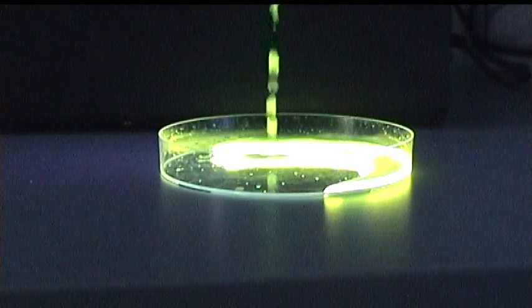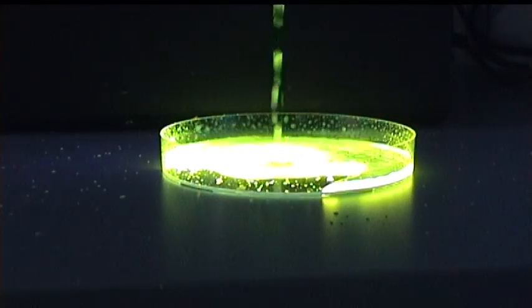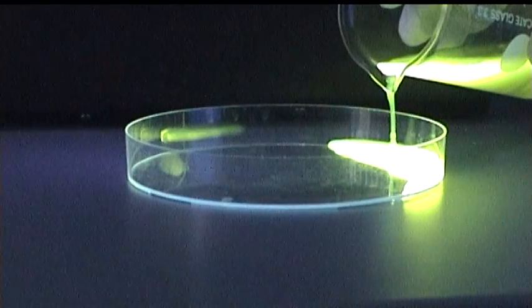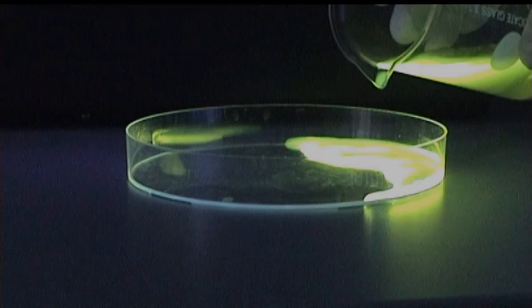Pouring liquid from heights is another activity which can generate aerosols. Pouring from great heights produces a large amount of aerosols and splashes. It is better to gently pour the liquid into the vessel, trying not to make any sudden movements.